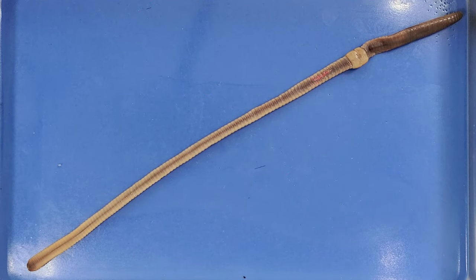Hello and welcome. Today we'll be taking a look at the anatomy of a worm. Worm is a general term for a large group of invertebrate animals that include earthworms, roundworms, flatworms, and more. The worm we'll be looking at today is an earthworm, which is probably the worm most familiar to you.